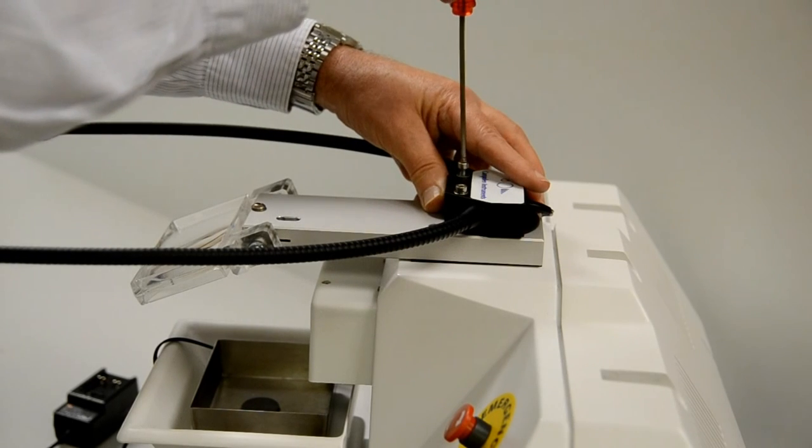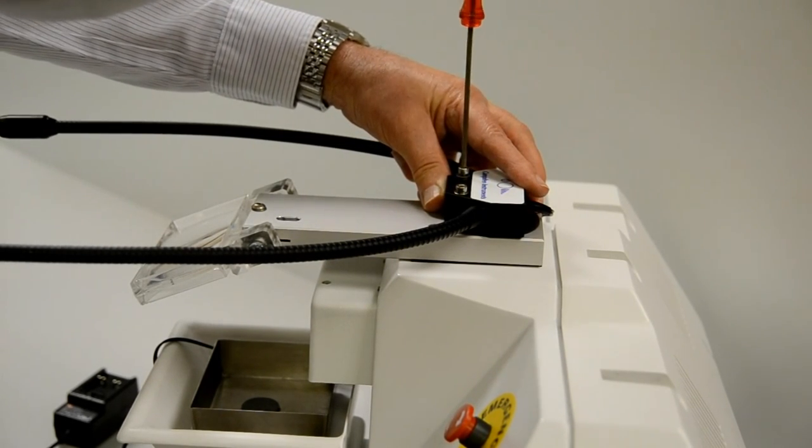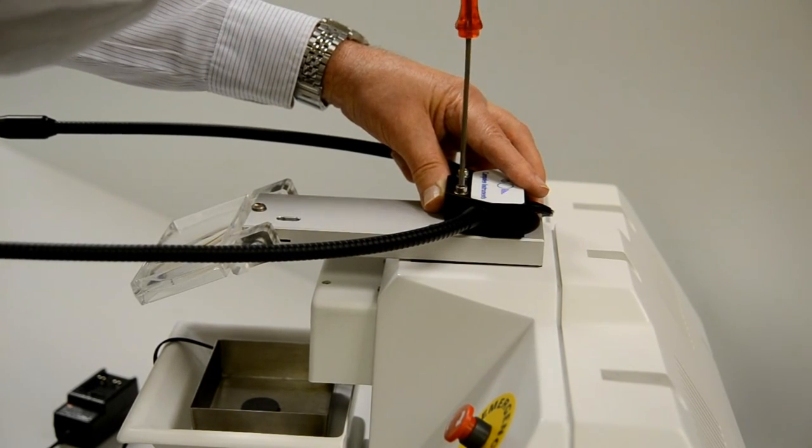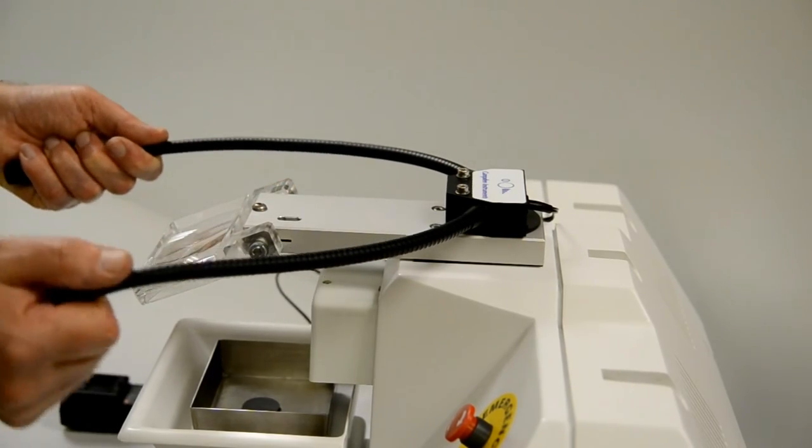If you are using the magnifier, you should fit the magnifier first and then fit the light source to the magnifier mounting plate. If you are not using the magnifier, then the light source can be fixed directly to the instrument cover.